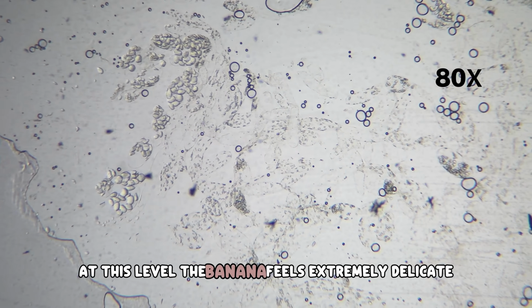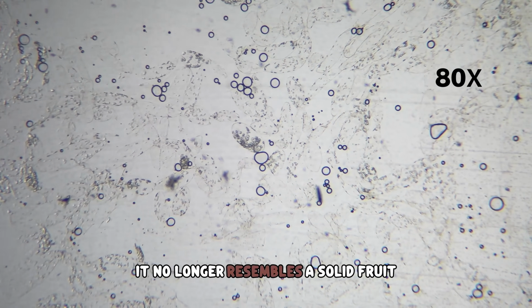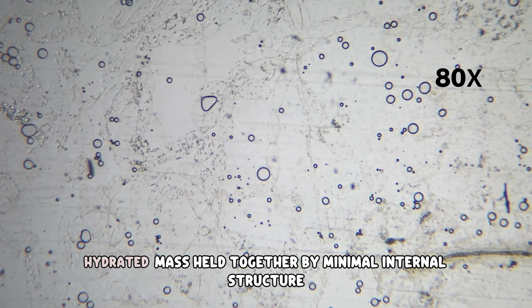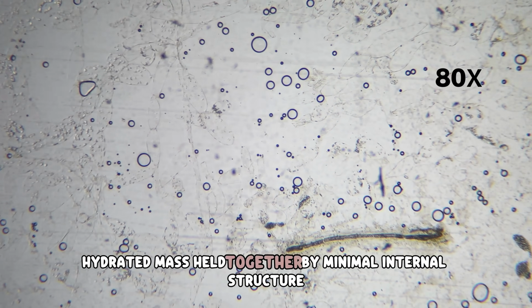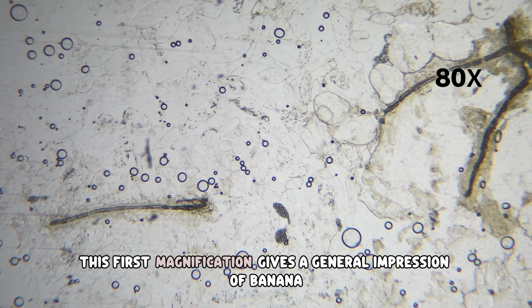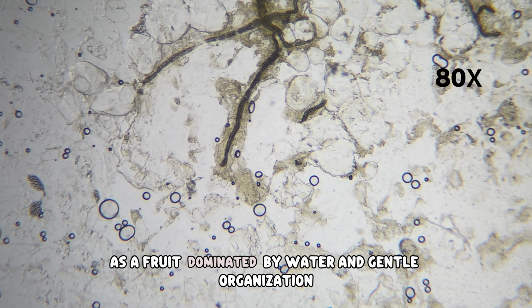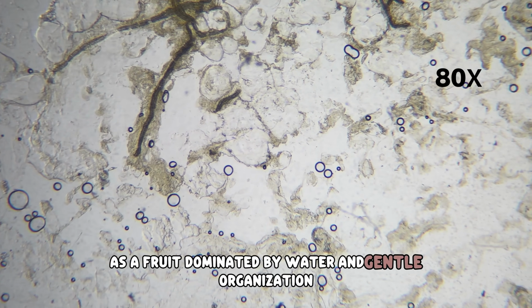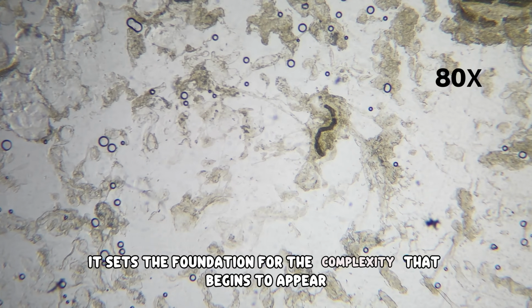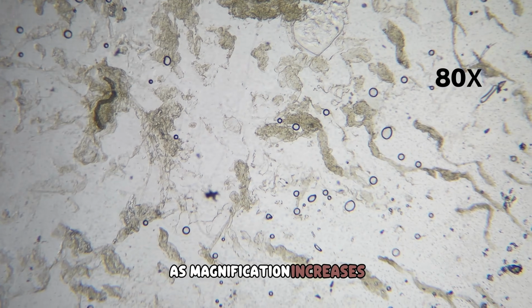At this level, the banana feels extremely delicate. It no longer resembles a solid fruit. Instead, it appears as a soft, hydrated mass held together by minimal internal structure. This first magnification gives a general impression of banana as a fruit dominated by water and gentle organization. It sets the foundation for the complexity that begins to appear as magnification increases.